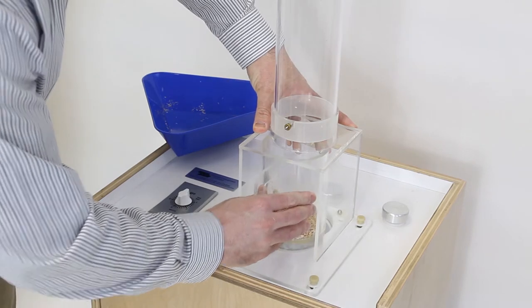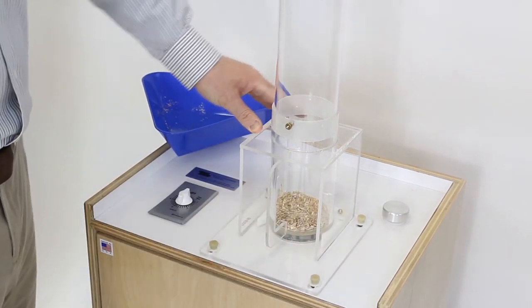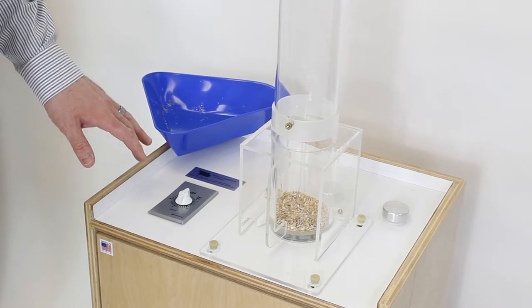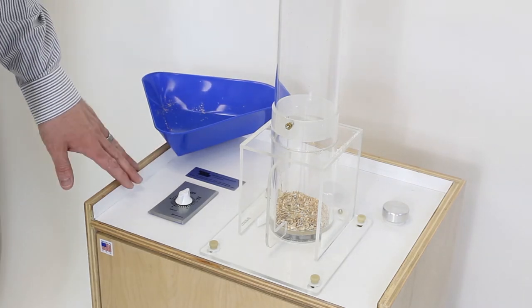We're going to place that cup into the bottom section of the tube set firmly and we're going to designate how long we want to clean that sample by setting the timer.